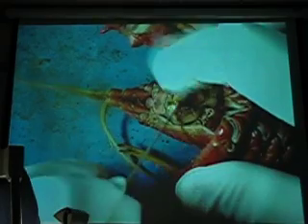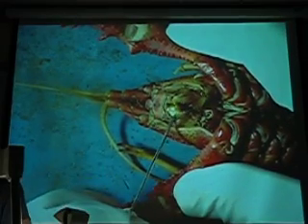Okay, got through a couple more here. There's a few. Oh, look at that. What is that? That's the mandible. Miss anything on the outside?